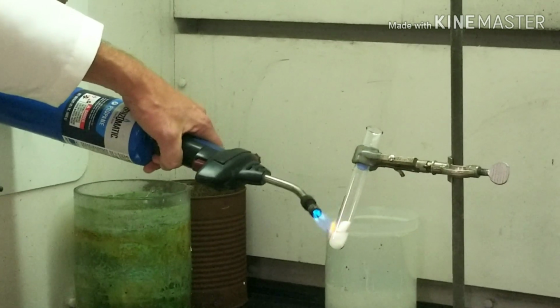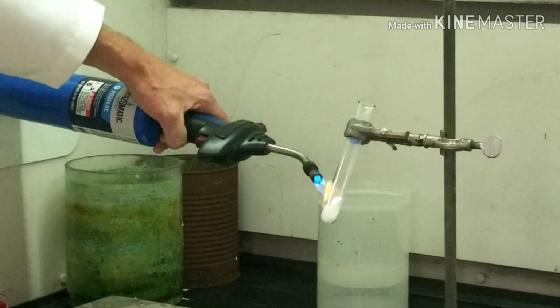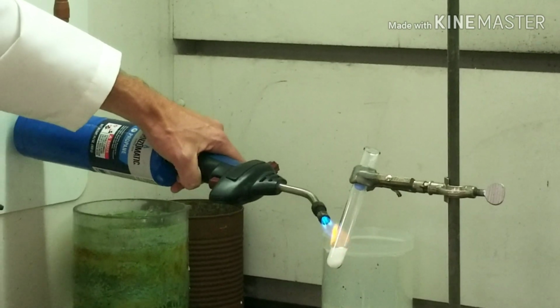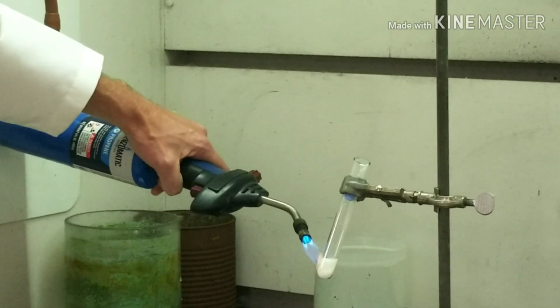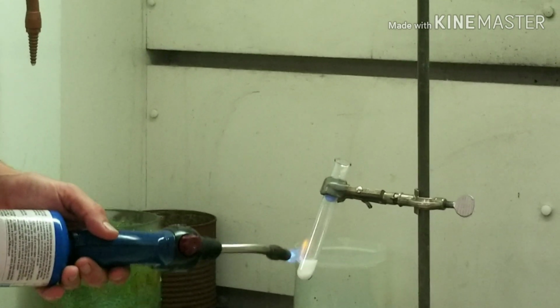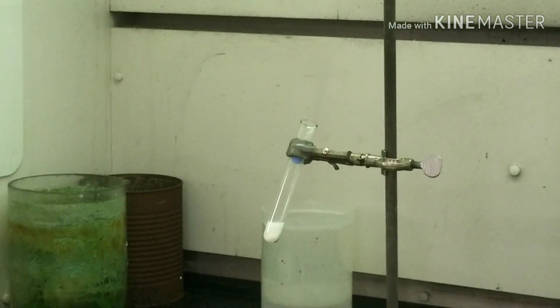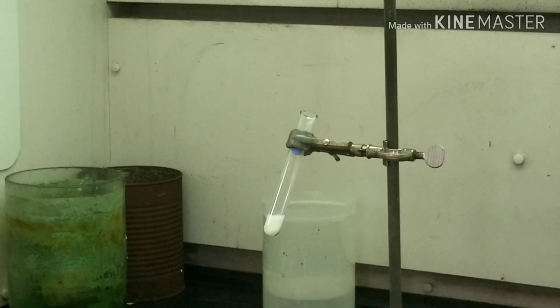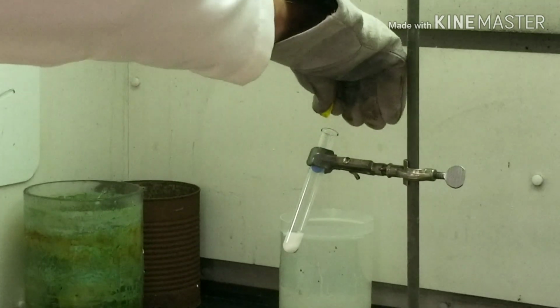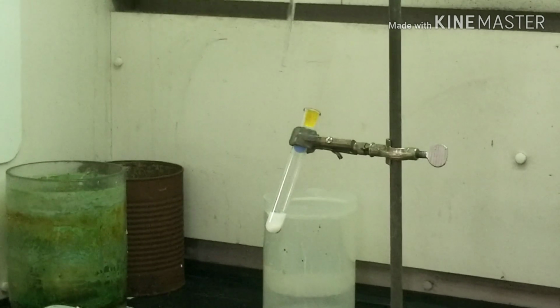Once the sucrose starts to combust, it happens fairly quickly. Those 7 calories get expended fairly quickly. All right, that last little bit is now turning molten here. We probably can't see it on camera, but there's bubbles happening. I'll turn this off. We're going to take the gummy bear with my gloved hand, and like I said, I'm probably going to have to push it down. Gummy bears are sticky.